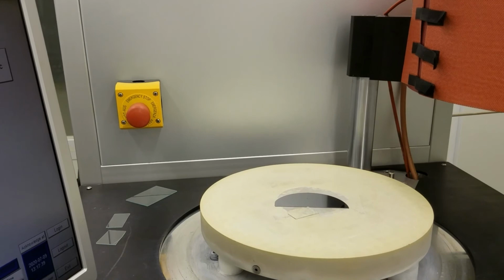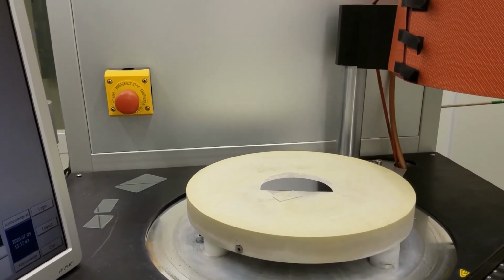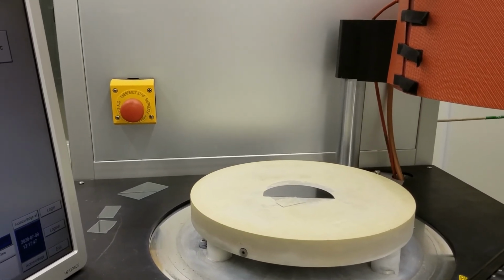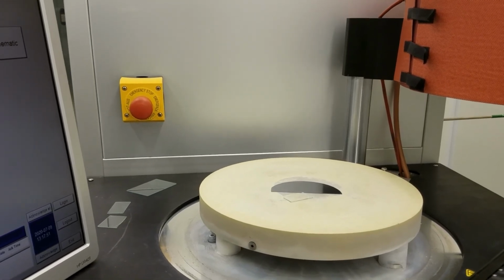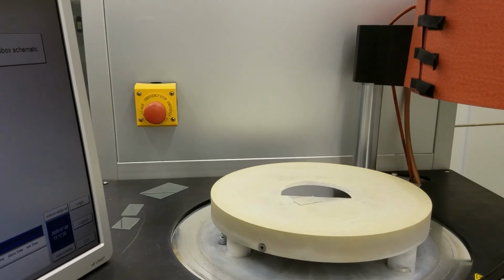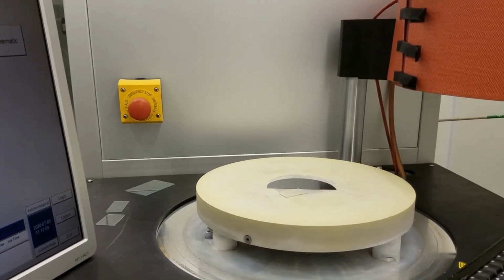If you look at it, we also have a glass slice, because there are no grooves on this substrate holder. So we put a piece of glass slice to prevent the wafer from moving around.